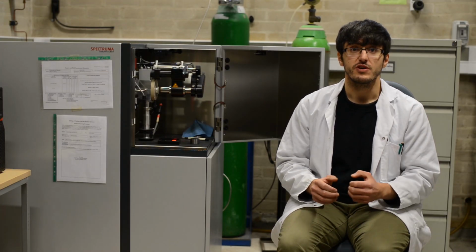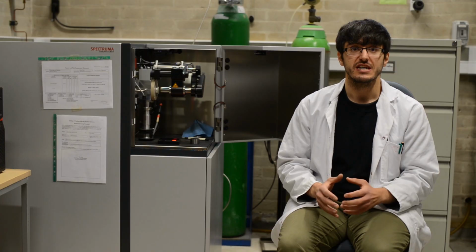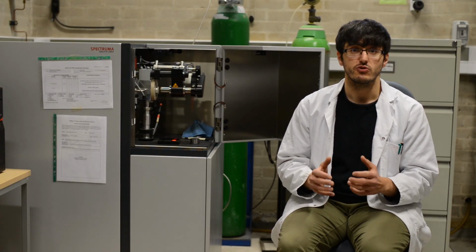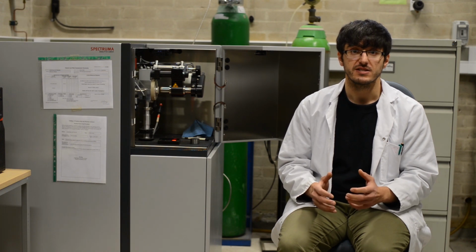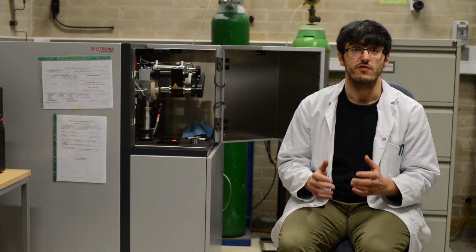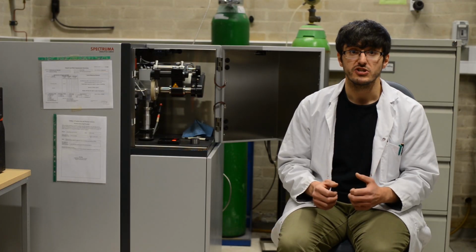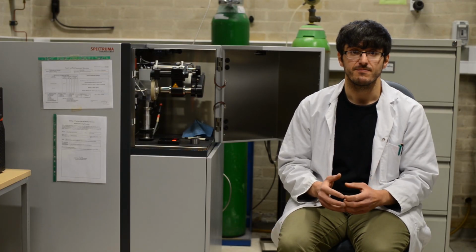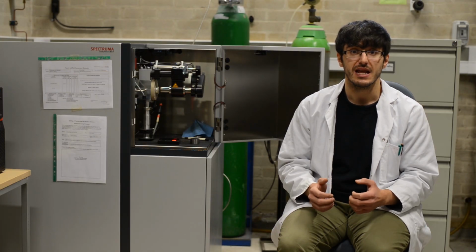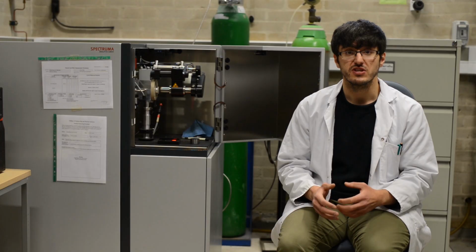As a result of the already mentioned qualities of GDS elemental depth profiling, it has found many applications in the automotive, electronic, aerospace, and steel industries, and is commonly used for measuring the thickness of coatings or the chemical composition of new alloys or castings. Additionally, it is also widely used in research and development labs, like those found in universities, such as this one.